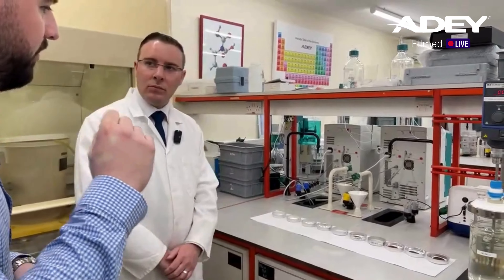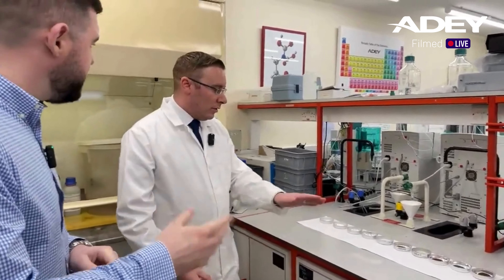And that's something that happens on all of our domestic testing when you send a sample through? This is the commercial testing. But we do do a lot of testing on the domestic for metallic corrosion.